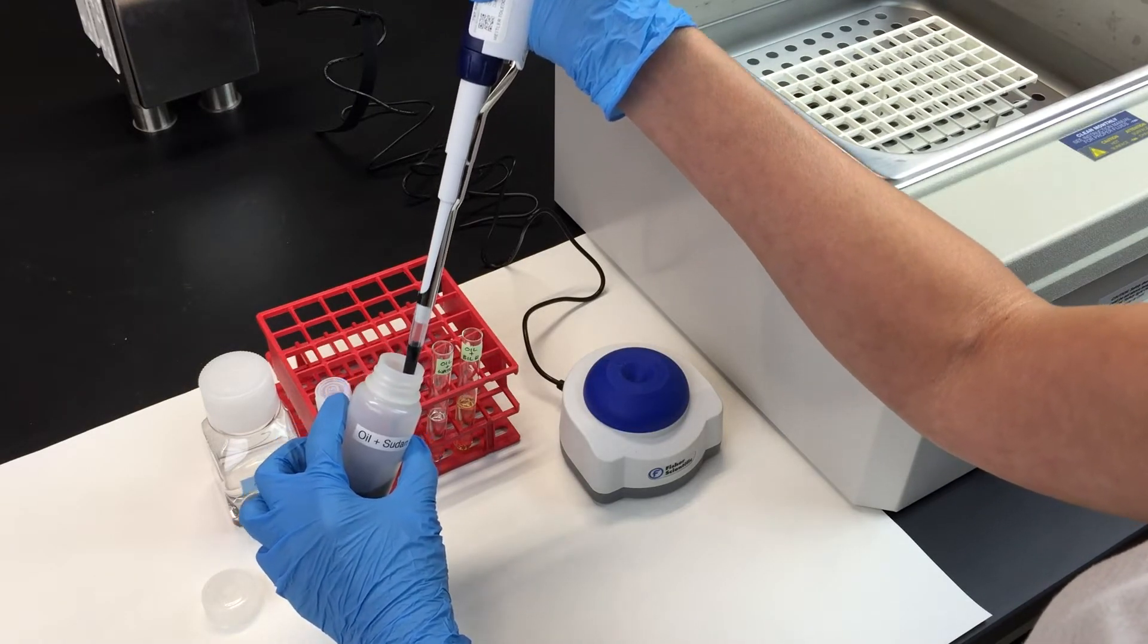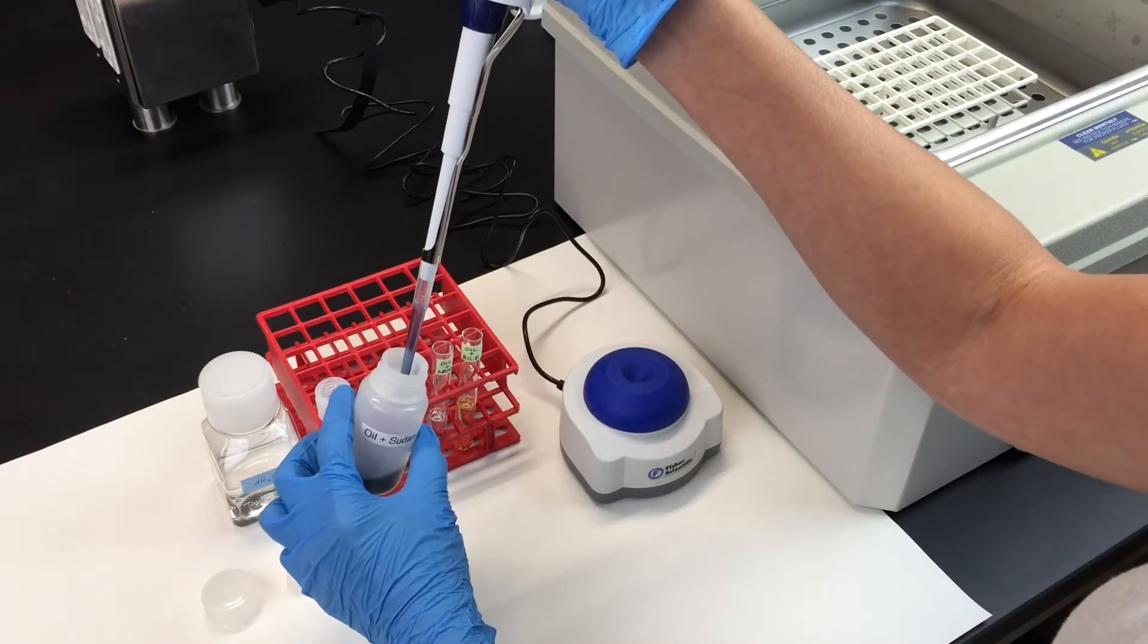If you pipette too fast, you could get air bubbles.